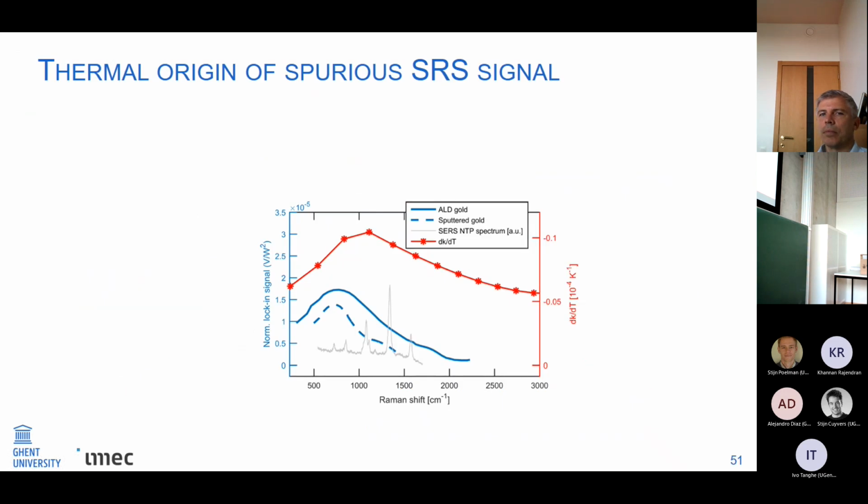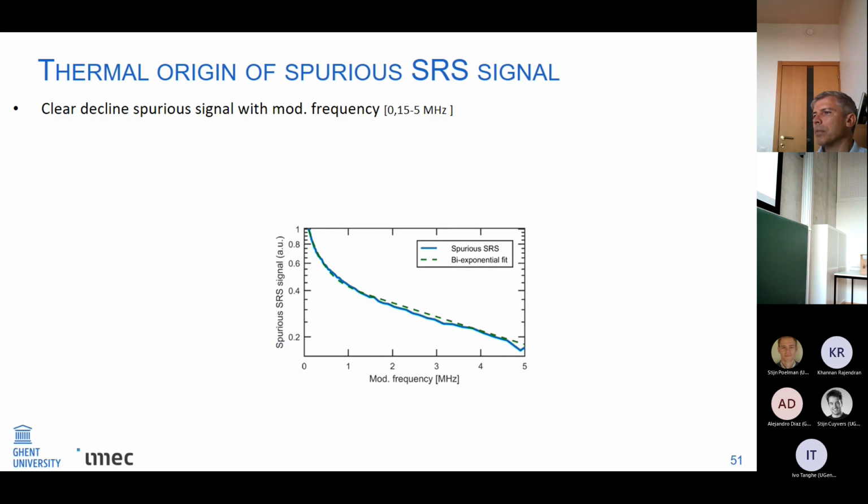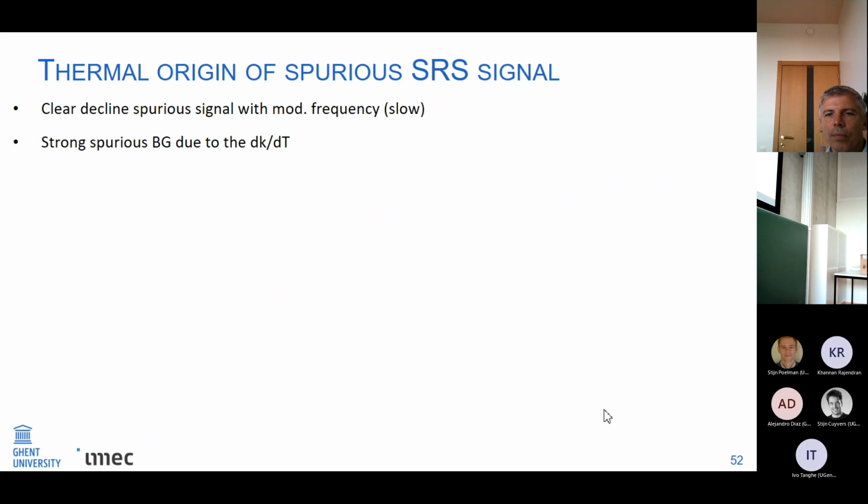So then I further had to confirm the thermal origin of this spurious SRS signal. And then what I did was actually increase the modulation frequency, and then I could see that the spurious signal actually has a clear decline with the modulation frequency, which points to the fact that we're looking at a slow effect, such as the thermal effect, while those other effects like cross-phase modulation, two-photon absorption, and transient absorption are considered faster electronic effects in nature.